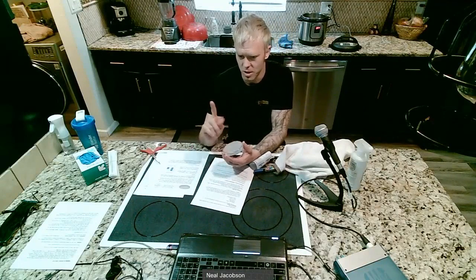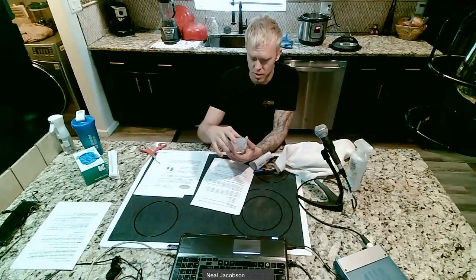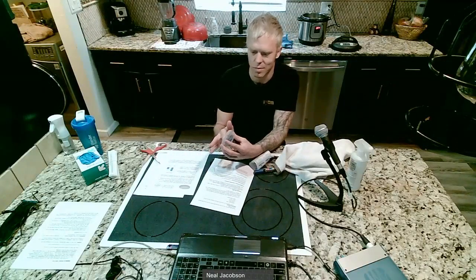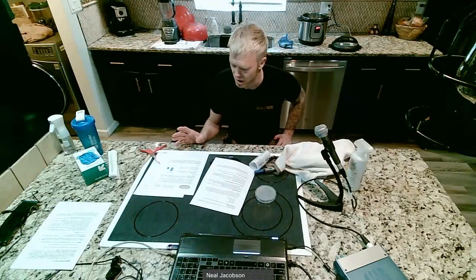So you open the petri dish and take your dirty hand and you're going to wipe your finger and cover the entire surface area of before. Okay, so I'm going to do that real quick. I'm even going to tilt my petri dish on its side so I have less of a chance of having mold spores fall on top of it or bacteria spores. Okay, as soon as I'm done, I'm going to put the lid back. That way it's not collecting any dust on it, so nothing's growing. Hopefully nothing's landing on it.